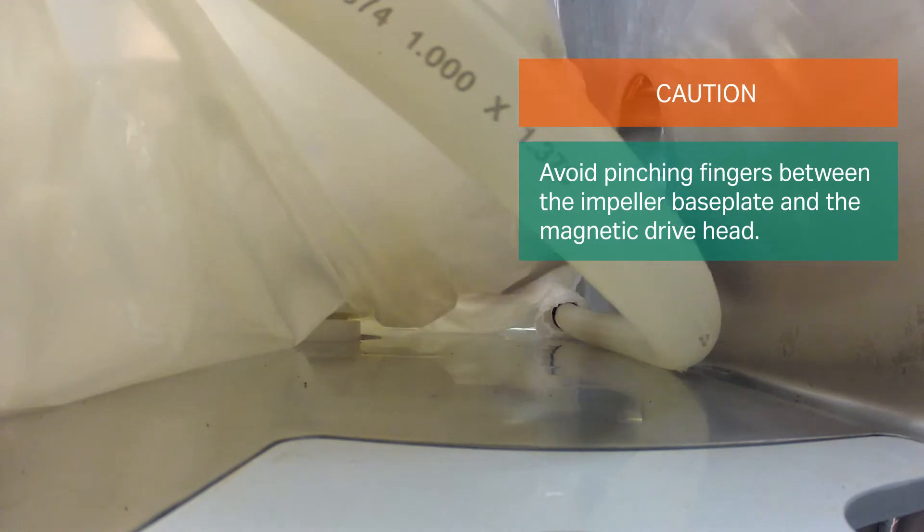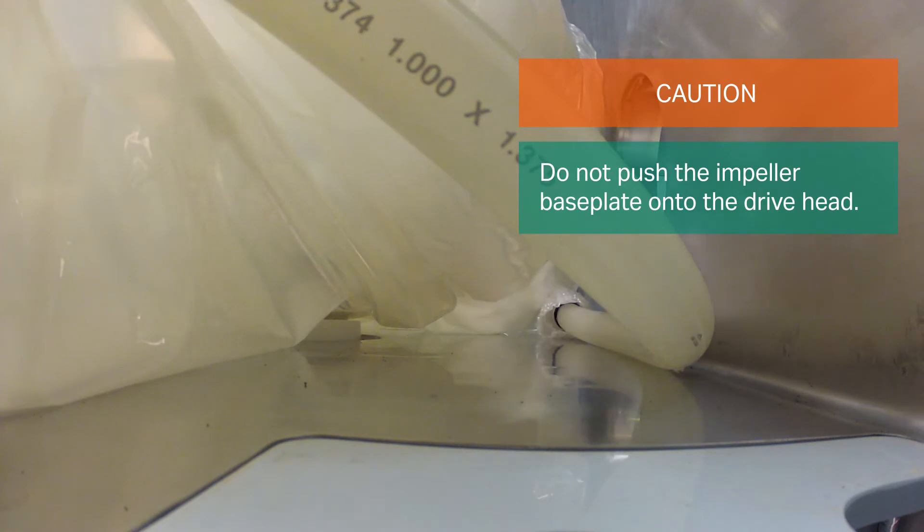Carefully lower the impeller base plate onto the drive head until it rests on the protective collar that surrounds the agitator drive head. Do not push the impeller base plate onto the drive head.